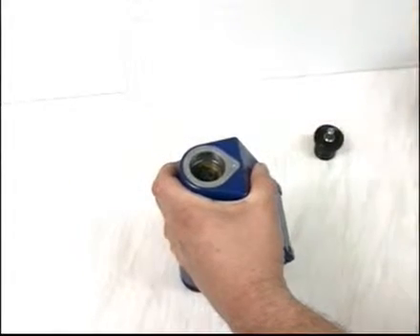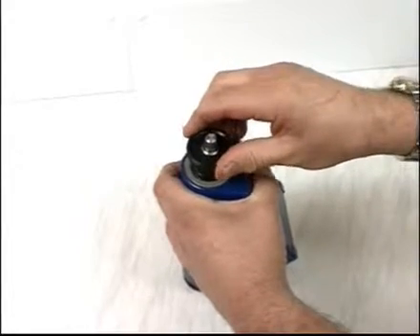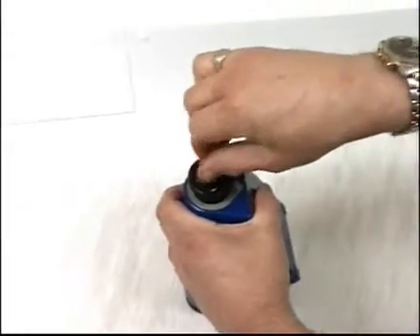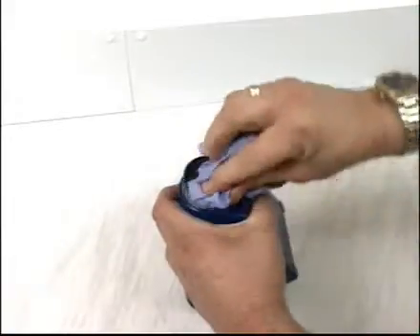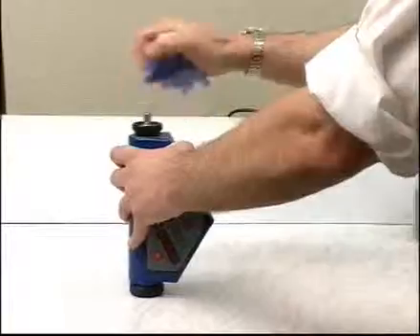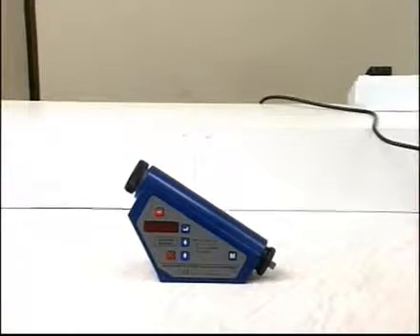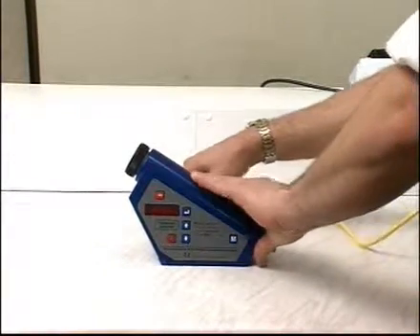With the valve still open, push the plug in gently until any remaining air is gone, then tighten the valve and wipe away any excess oil. Connect the power cable, and the viscometer is ready for use.